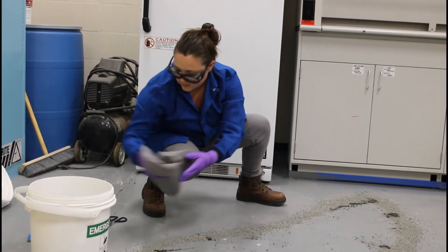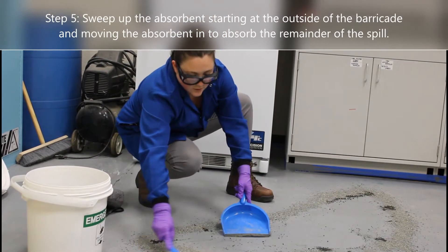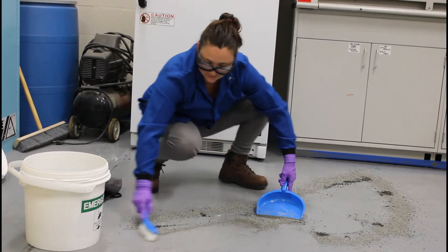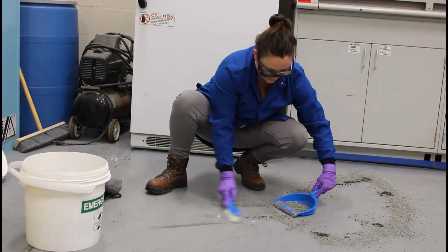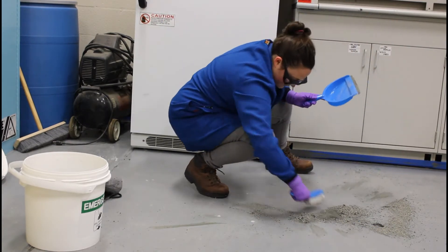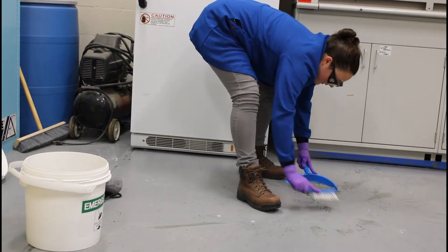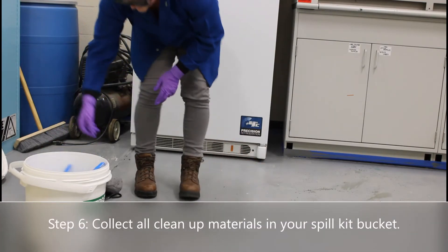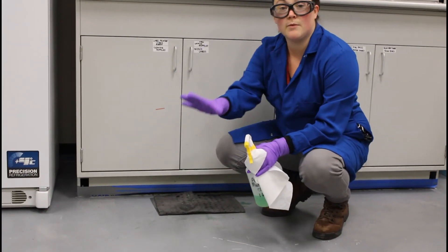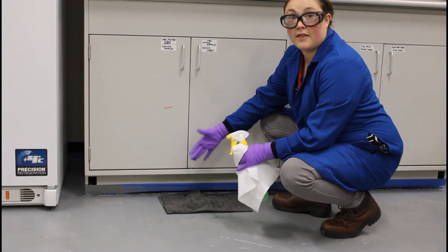Sweep from the outside in to absorb the rest of the spill area. All of your cleanup materials can go in your waste bucket. After you address the main part of the spill, also check your vertical surfaces to see if there is any spill material there that you need to address.